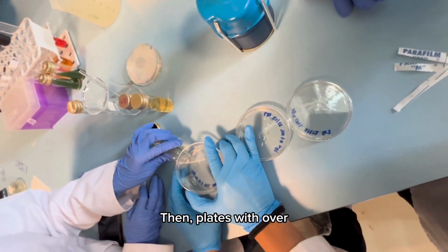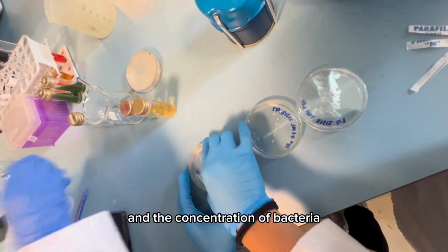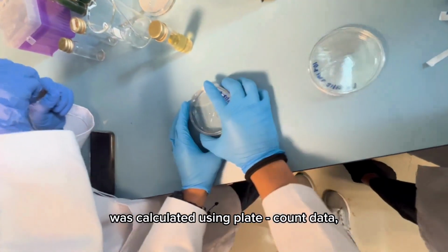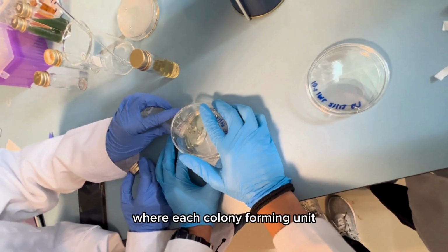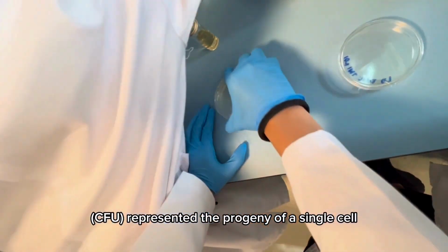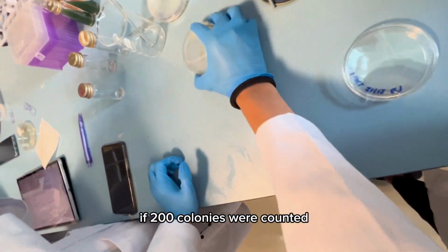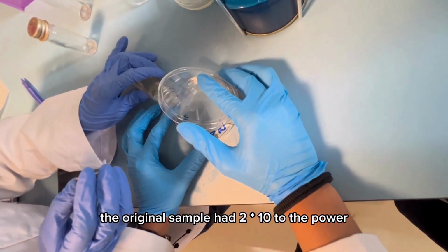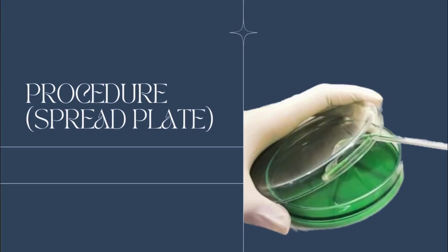Then, plates with over 300 colonies were noted as TNTC, and the concentration of bacteria in the original sample was calculated using plate count data, considering plates with 30 to 300 colonies, where each colony forming unit, CFU, represented the progeny of a single cell. For example, if 200 colonies were counted on the 10 to the power -4 plate, the original sample had 2 times 10 to the power 6 viable cells per ml.